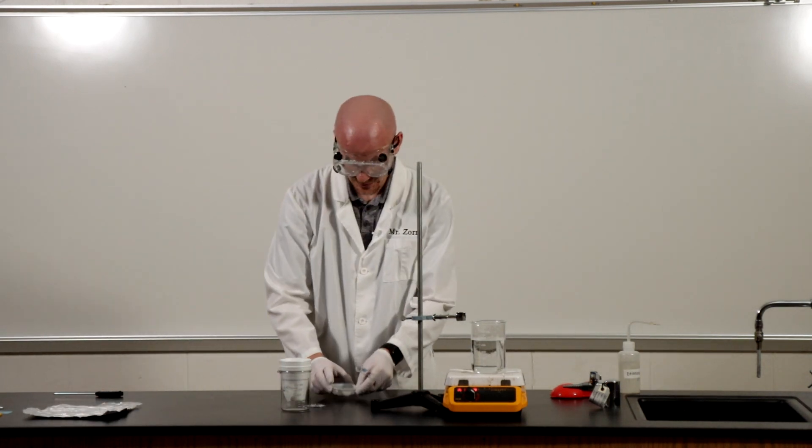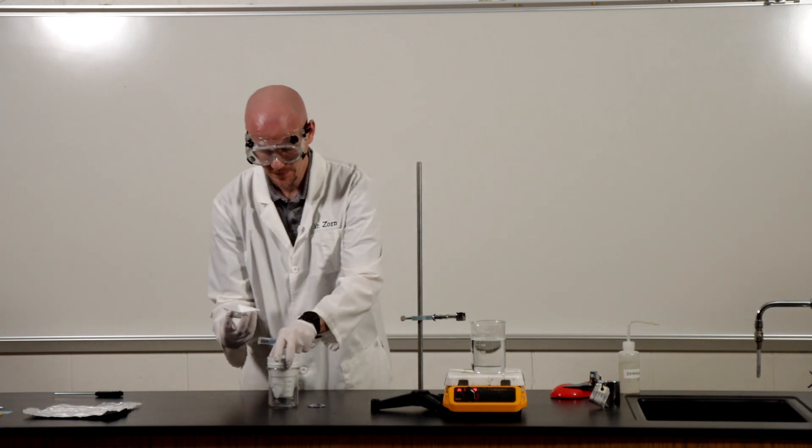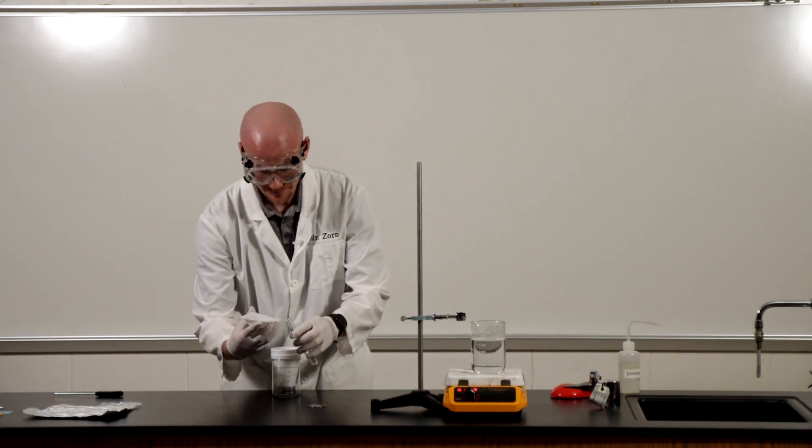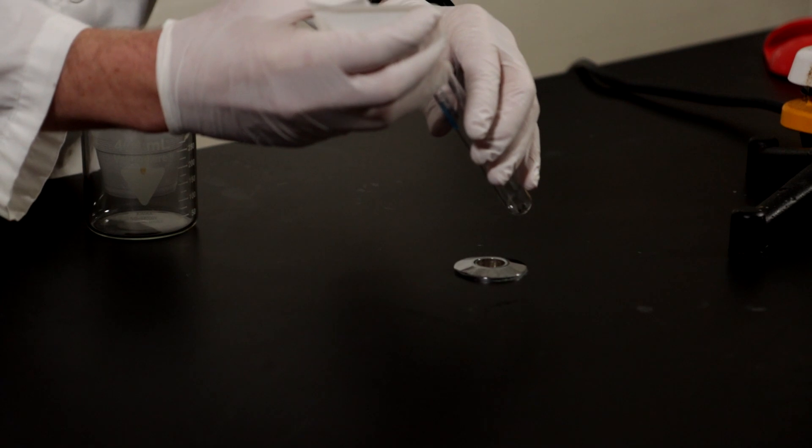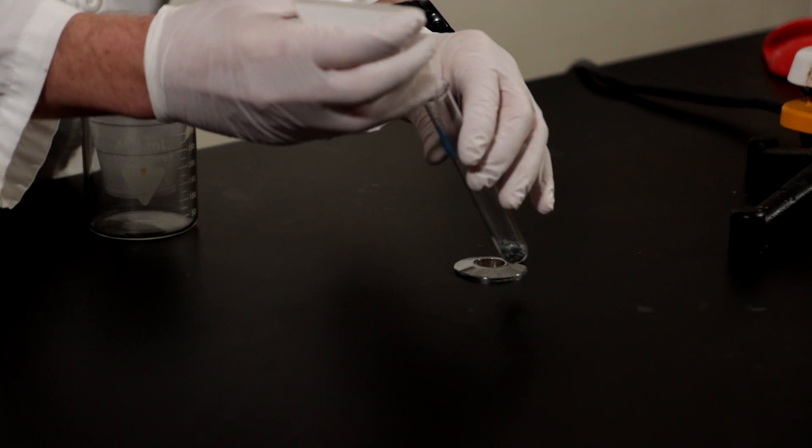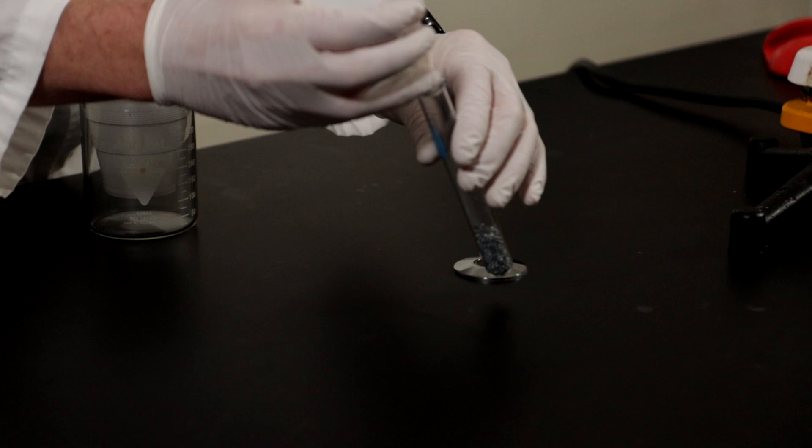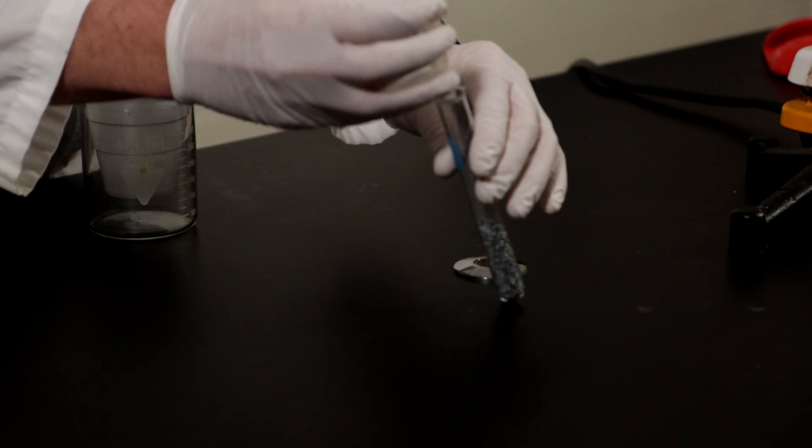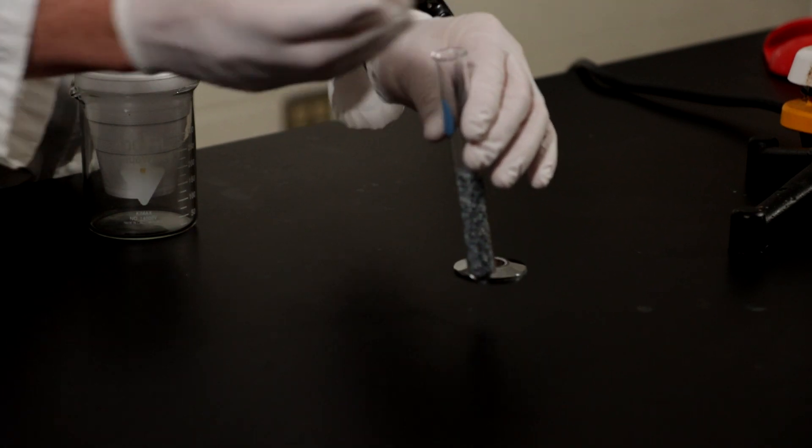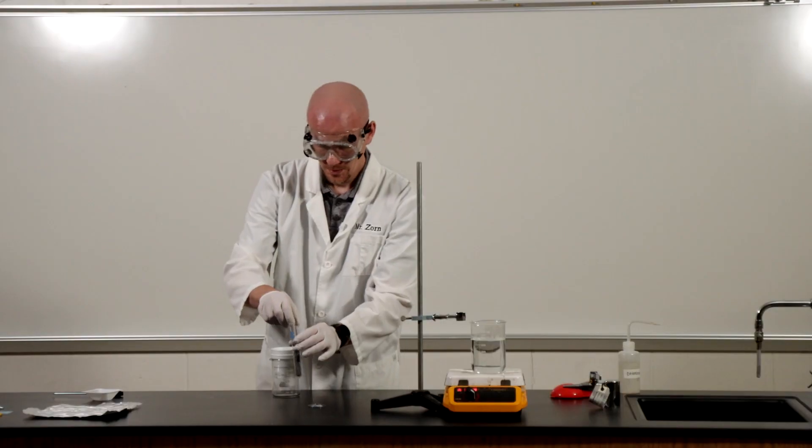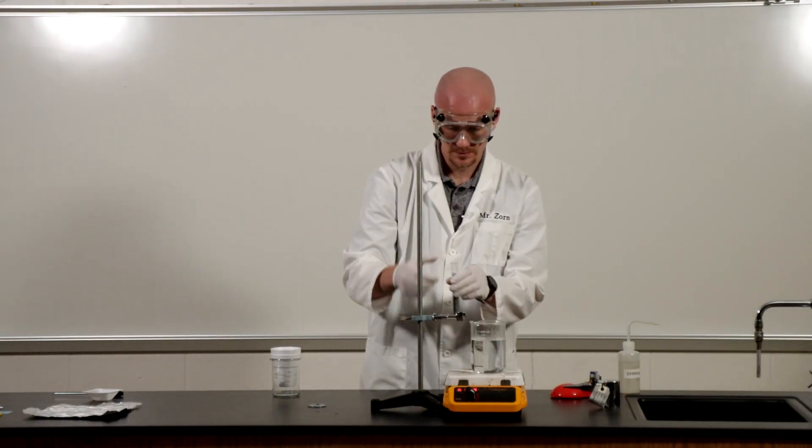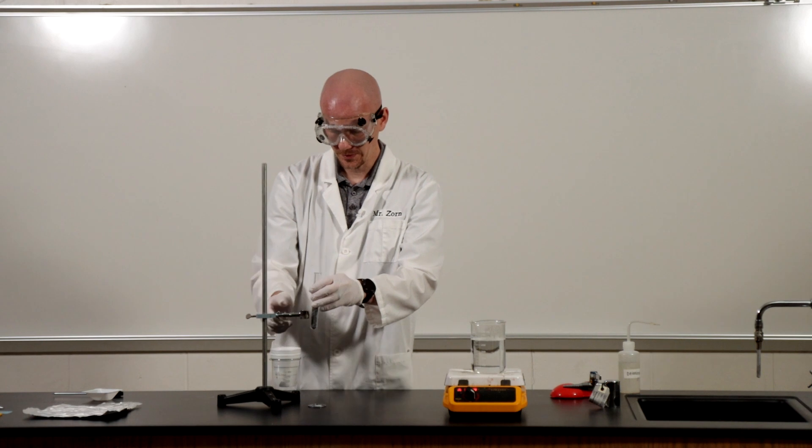Very carefully I'm going to transfer my metal sample into the test tube here and I'm going to clamp this into my test tube holder here.